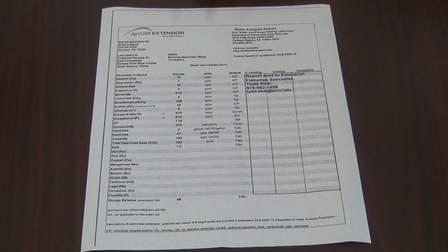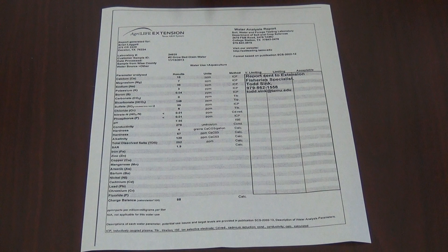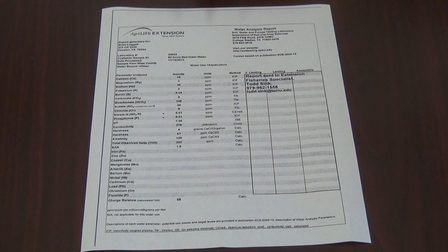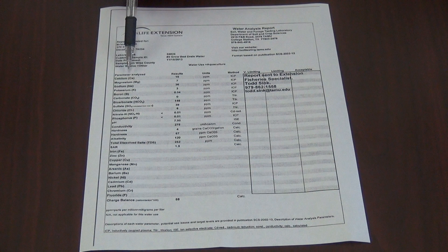Here we have a report where the landowner marked the aquaculture box. Some of the first items that a fisheries extension specialist will look at when interpreting your report are the calcium, carbonate and bicarbonate, pH, hardness, and the alkalinity. The first item we will look at today is calcium, which is located at the top of the list.